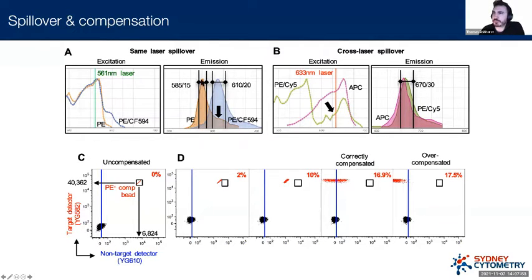If we look at this sort of brown, yellow, orange, brown curve, this is the emission spectra for PE. So if this one on the left is the excitation spectra, we sort of get to see whereabouts this fluorophore is most heavily excited. In this panel here, we get to see where it emits. And so you can see here in terms of the wavelength, there's a maximum emission for PE around 580 nanometers. And so we can use an optical filter to collect that light in the system. But what you'll notice is that in the next detector down, different filter settings, we have a certain level of spillover. This is like contaminating the detector next to it. And this detector is the one that we want to pick up this blue signal, which is the PECF594.